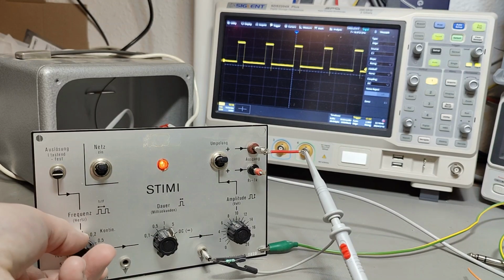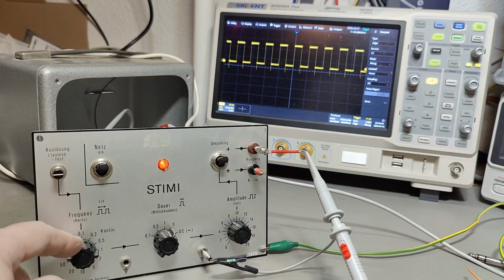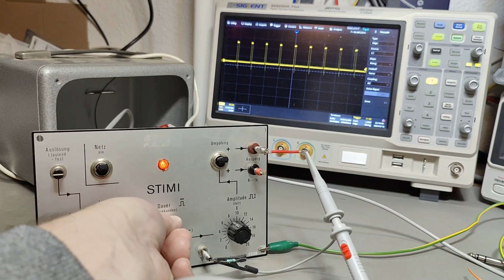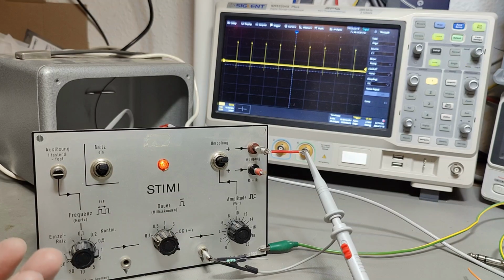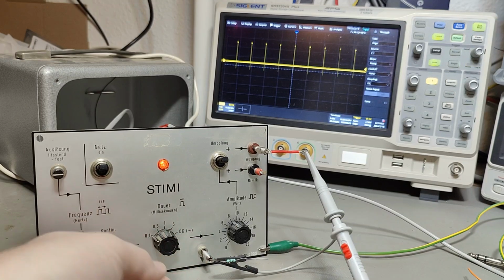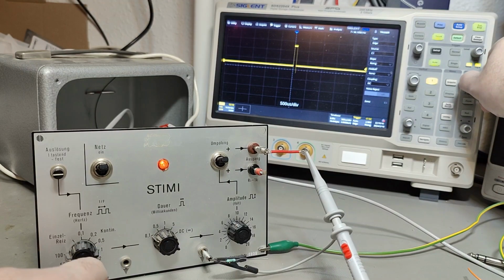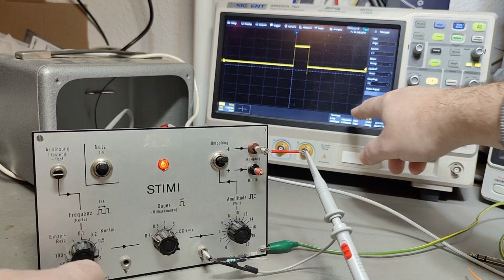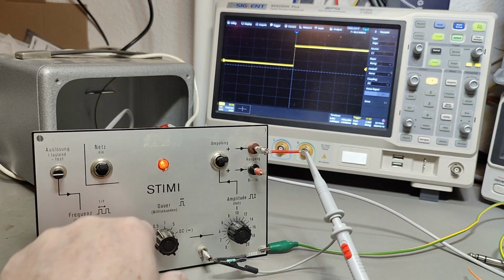And here is the repeat. See, now it goes closer and closer. And at this speed here, of course, I can make the pulse width smaller and smaller. So yes, this fantastic 4-transistor project definitely works, I must say. So this is the smallest, and what is it? It says 0.1 milliseconds. Okay, so that means this should be 0.1 of a millisecond. How about if we check out if this is really true? What the heck? This is exactly 100 microseconds.